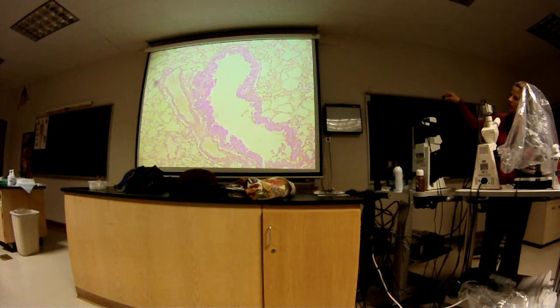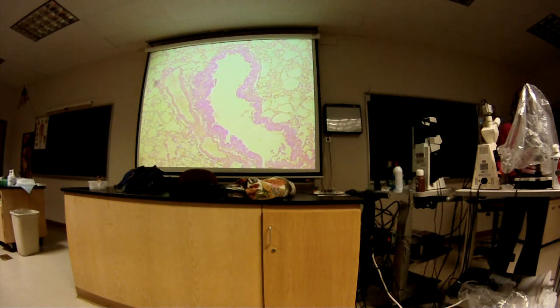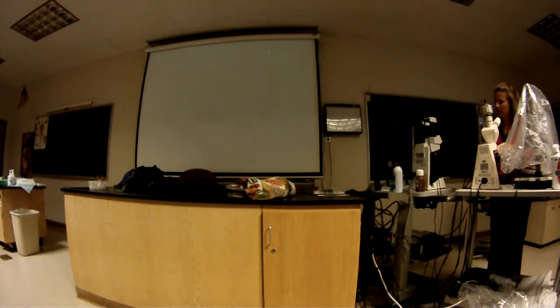Smooth muscle. I see it here, a little here, over here. Obviously, you can't determine the epithelium from here. It looks like it's kind of wavy, this structure. I don't see any cartilage. Do you see any cartilage? No. This is a structure where the mucosa will kind of fold in on itself when it's deflating, when it's in the bronchoconstriction phase.